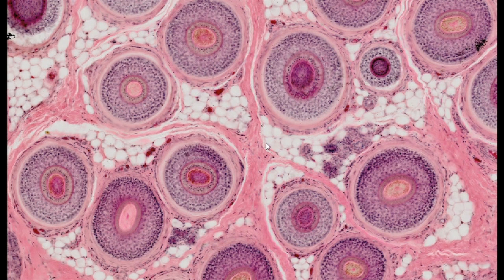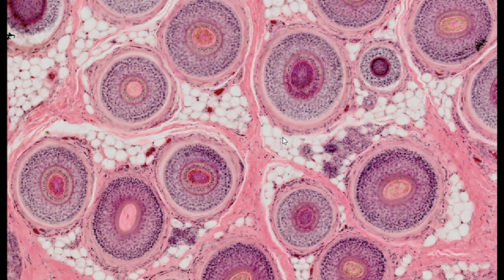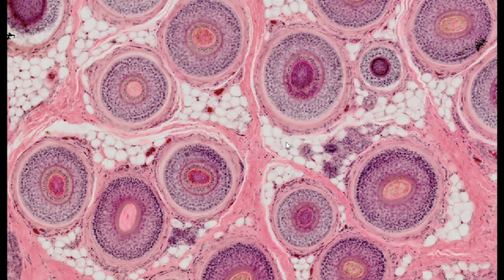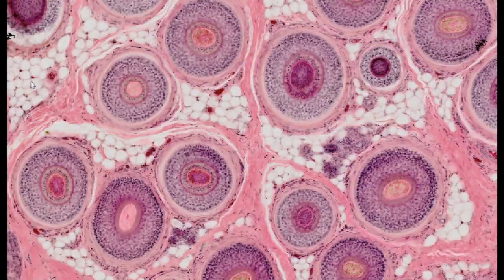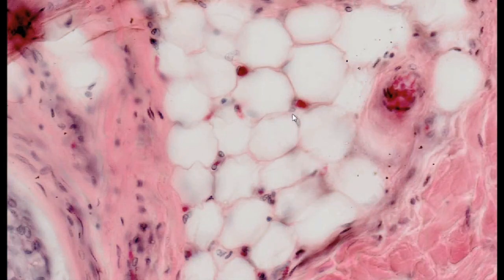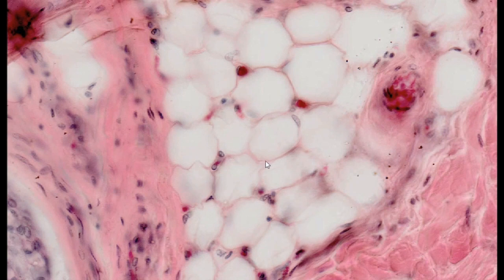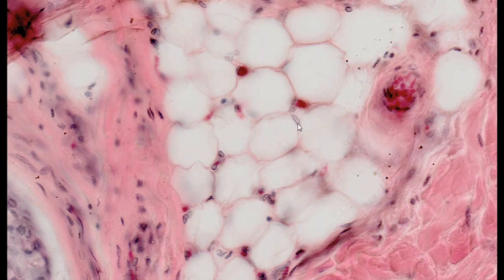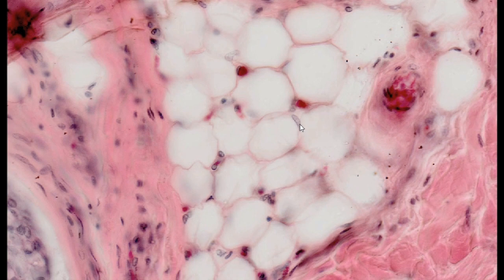Within the lobules, large cells are visible, almost the entire interior of which is filled with a single lipid drop. It is surrounded by a narrow border of cytoplasm stained pink with eosin. The hematoxylin-stained nucleus and other cell organelles are located at its widest point.